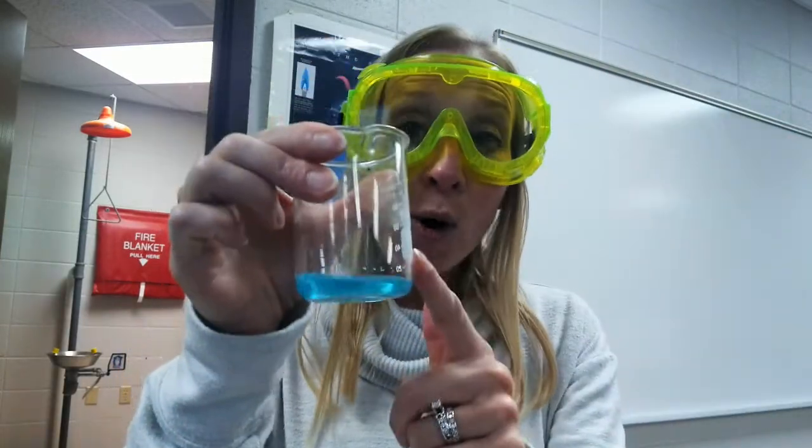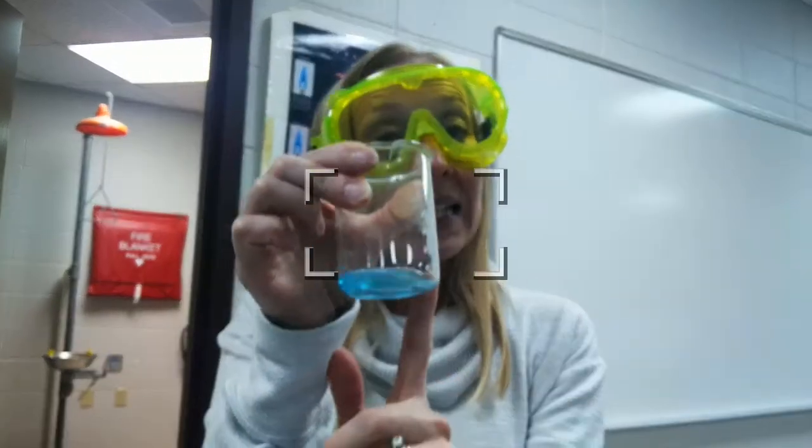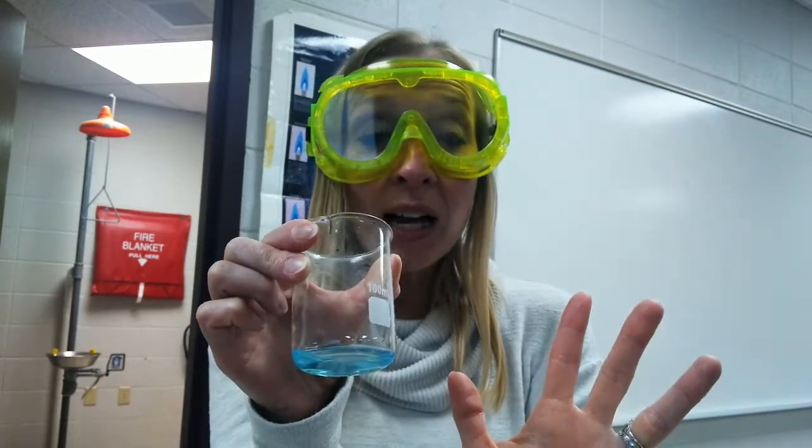Now we've got to get chlorine ions into this solution, and the vehicle for getting chlorine ions in the solution will just be salt, sodium chloride. So we want to make sure we add enough chlorine to completely react every silver ion in this solution. I don't want any silver left behind, going down through my filter paper when we eventually filter.